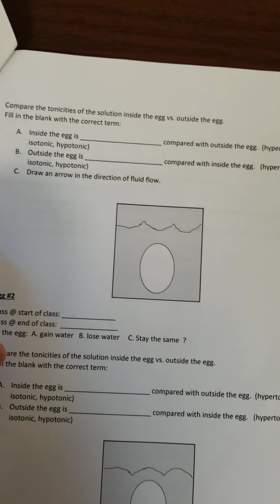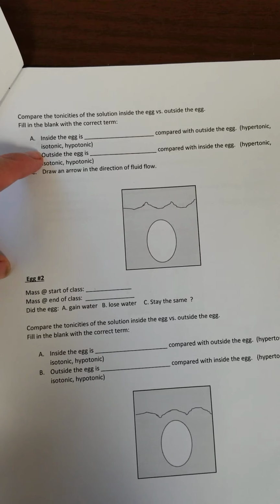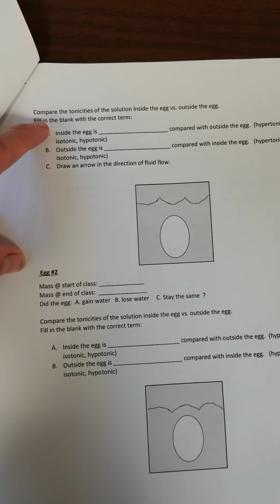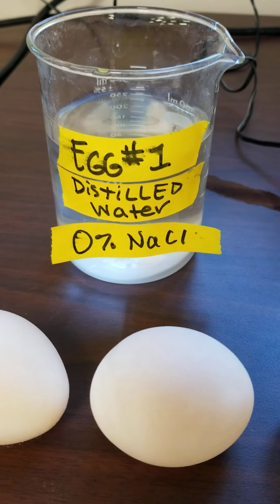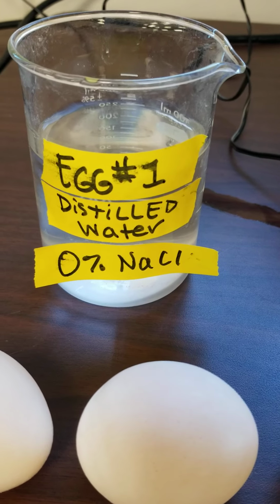The next thing you're going to do is answer the questions and state whether the eggs are hypertonic, isotonic, or hypotonic, comparing it with the solution that's found on the outside of the egg. So what we're going to do in each of the beakers is put a different solution. In the first, with egg number 1, we're going to put the egg in distilled water.